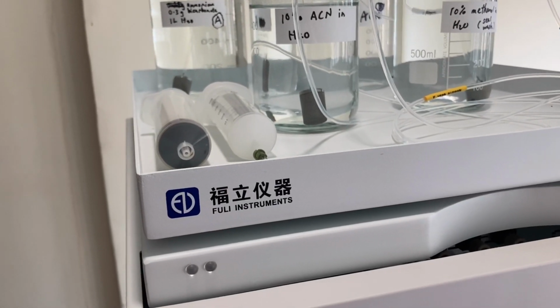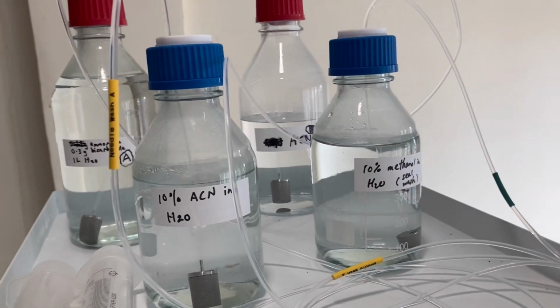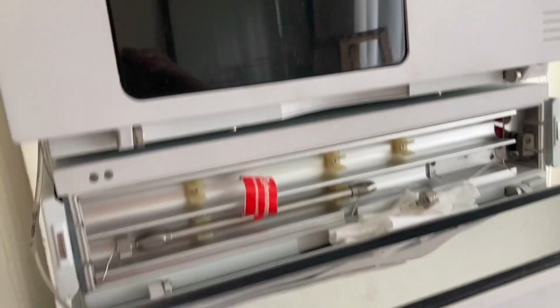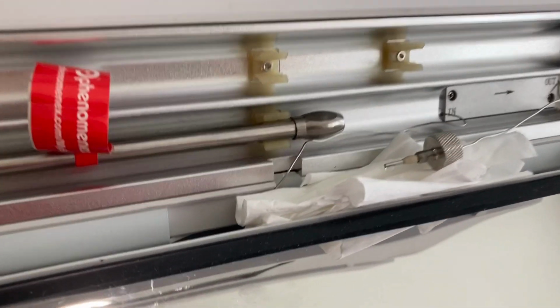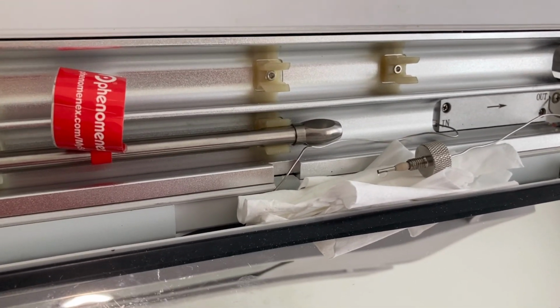The important points for starting up the Fuli HPLC. Right, first we don't want air going into the column, so disconnect it. I've done it like that, just putting a bit of tissue there to catch any solvent that drips through.